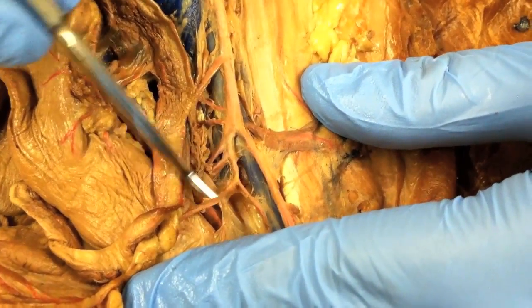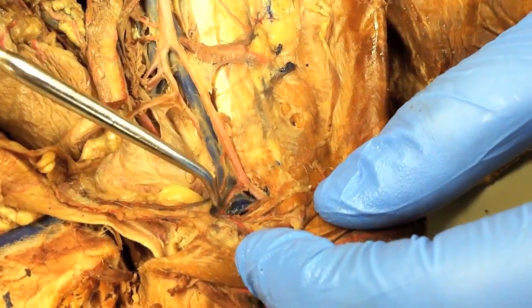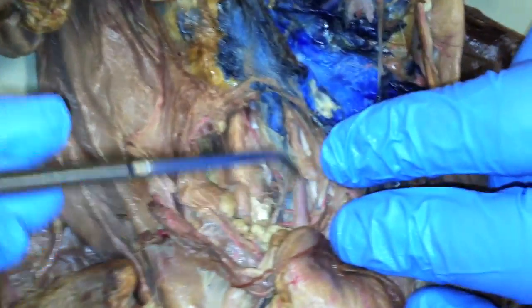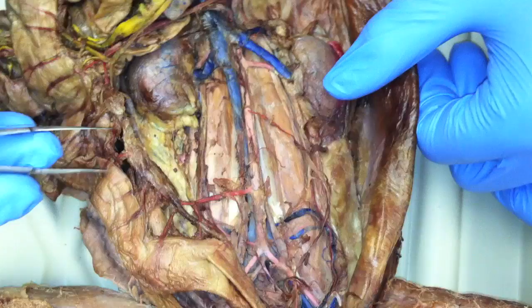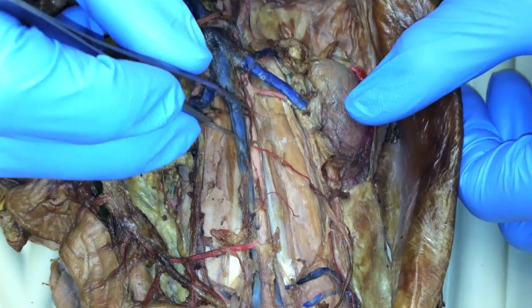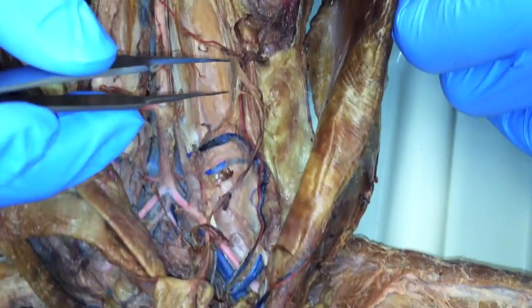So this is the internal iliacs. This is the external iliac until this branch — femoral and deep femoral. We have a female and we have a male. This is the female gonadal artery coming off of the abdominal aorta, running to the ovaries. And here's the male: here's the abdominal aorta. Here's your renal. Coming off the abdominal aorta, posterior to your renal is your gonadal, which will run all the way down into the testes.